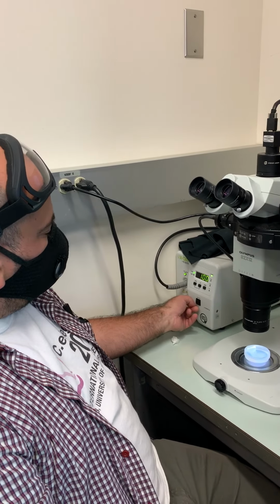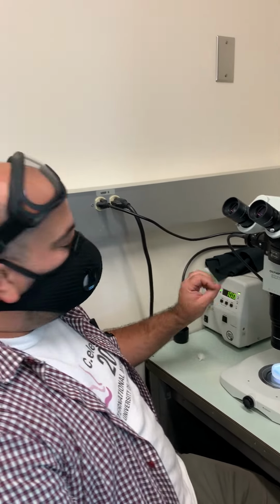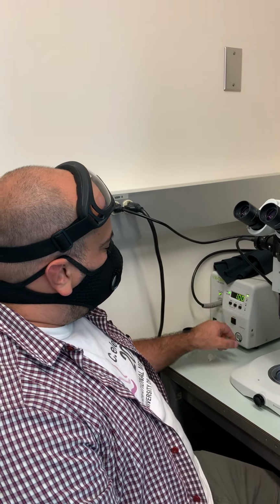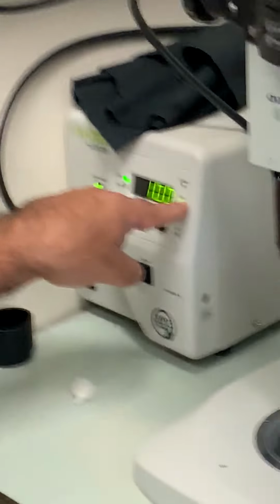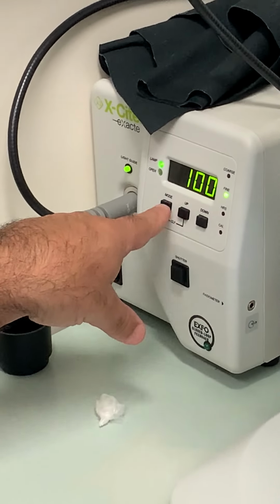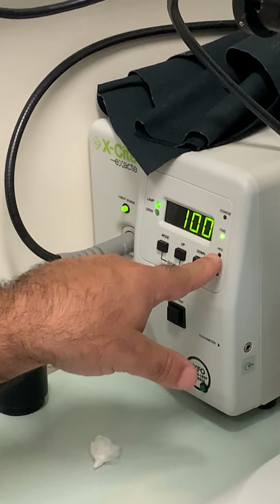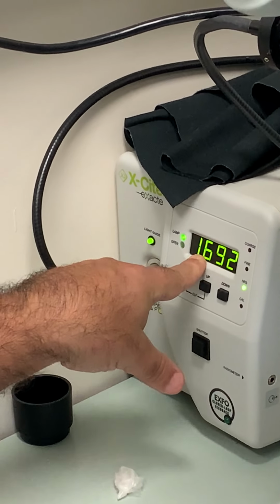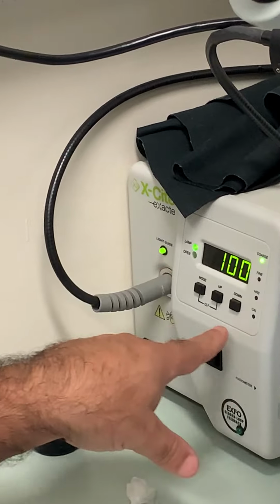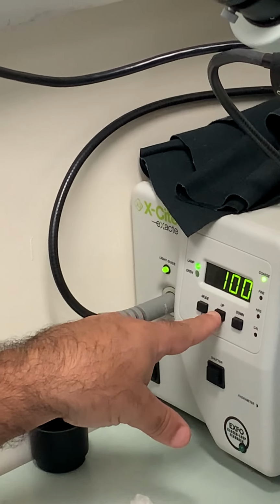When you turn it on for the first time, it's going to take some minutes to warm up. These numbers are going to be blinking, and eventually they're going to go solid. There is a button here for the mode that tells you whether you are changing the coarse or the fine adjustment, and how many hours this lamp has on it. I'm going to go to the coarse adjust, and then you see up and down.